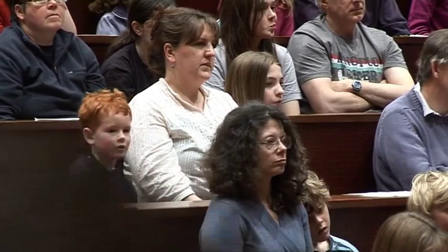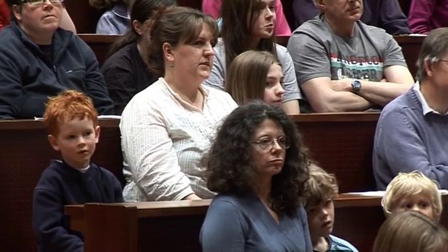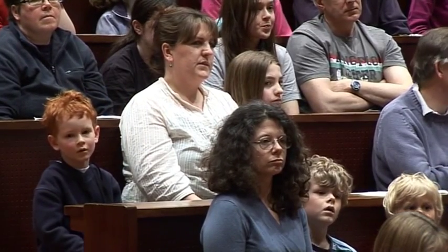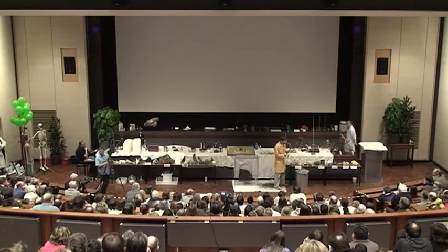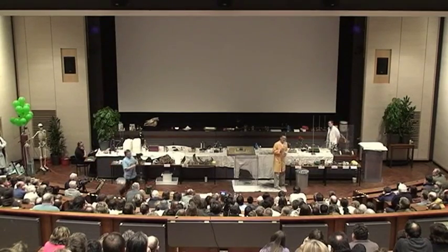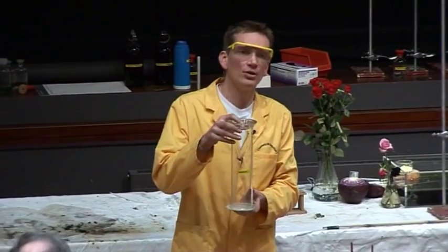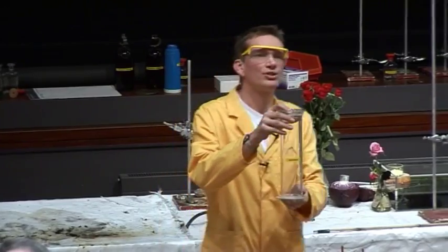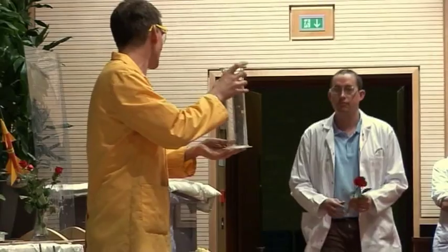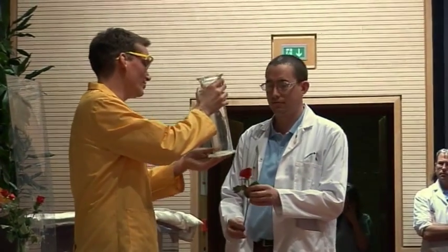We're going to look at the properties of some ammonia. One of the properties is that it's lighter than air. So we've got a tube here filled with some ammonia, and we're going to put a flower in this — a beautiful rose, a lovely red rose.